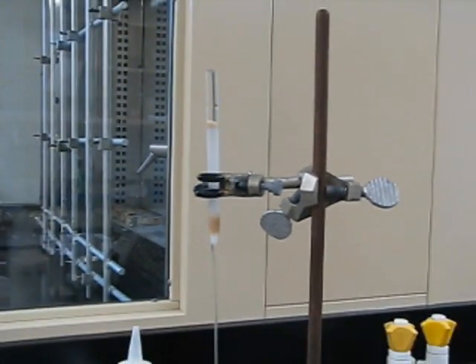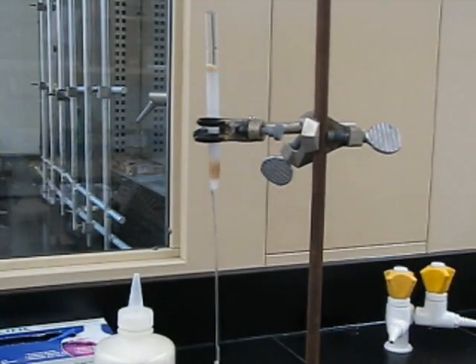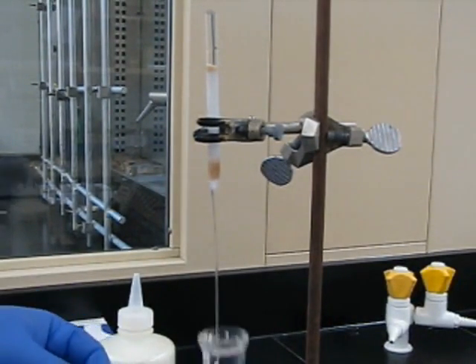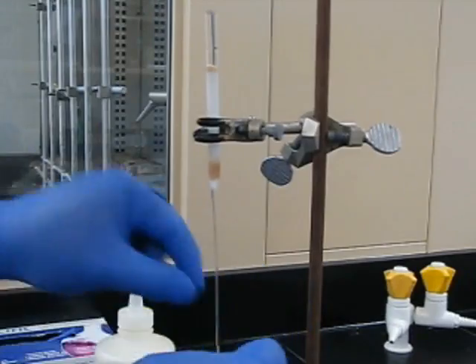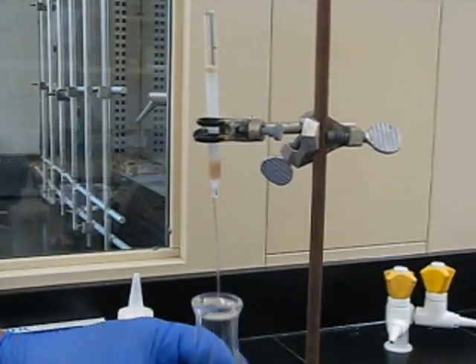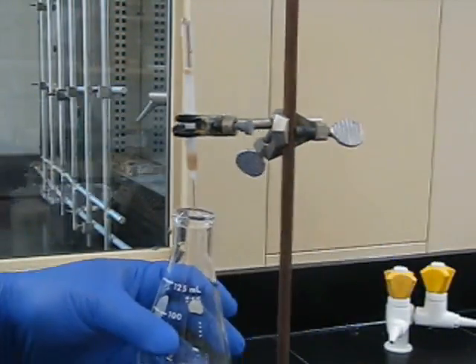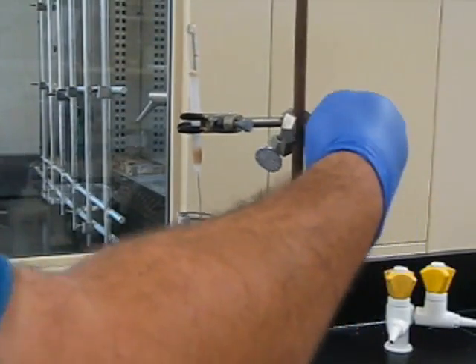Now we're going to break off the bottom of the pipette tip and grab a flask or a test tube to be ready to collect the solvent as it comes out. Firmly grip the pipette with both hands and snap with the lower thumb and forefinger.